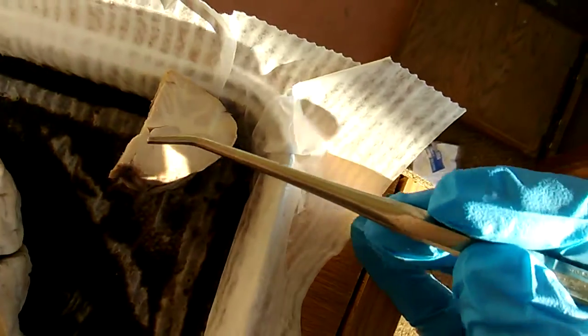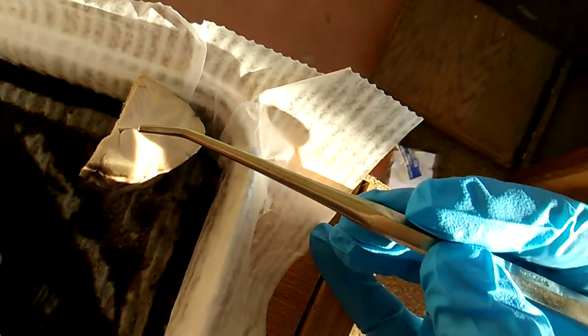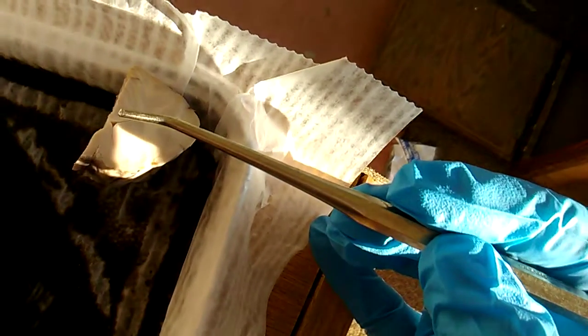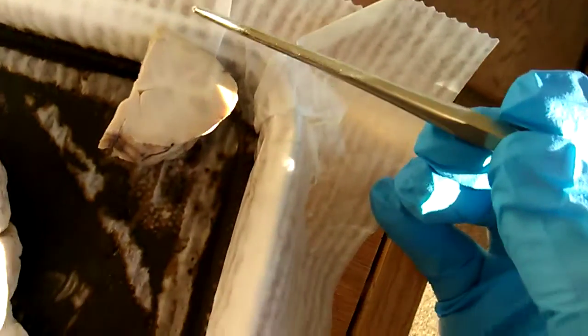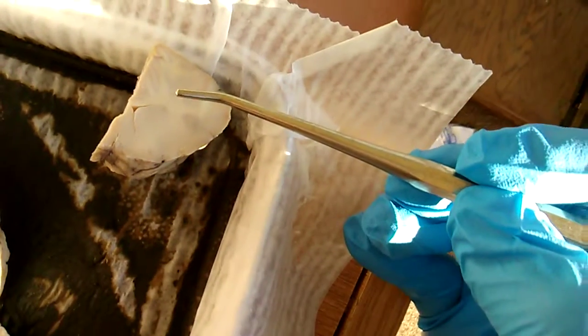And then the gray matter is where the cell bodies and the dendrites, axon terminals, synapse, and transfers all that electrical activity from one cell to another. So that happens in the gray matter. So in the central nervous system, there's those two different kinds, the gray matter and the white matter.